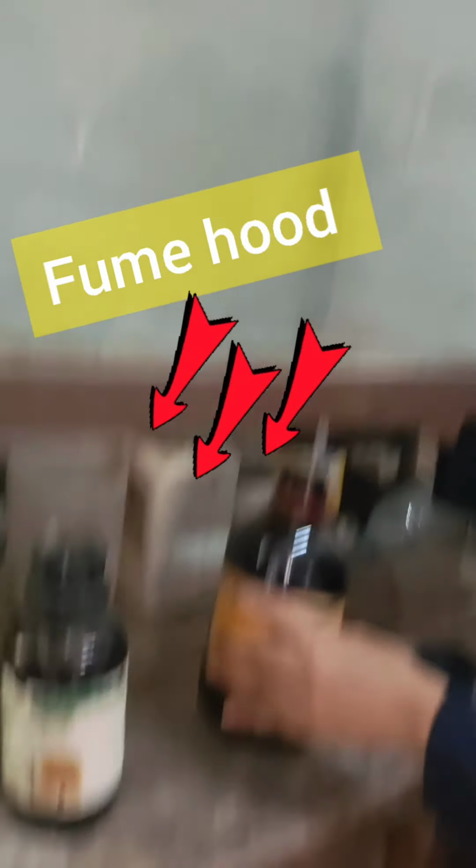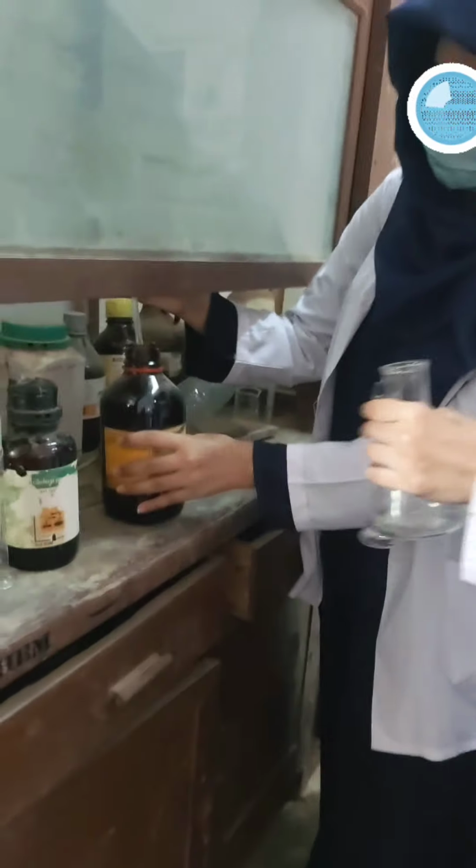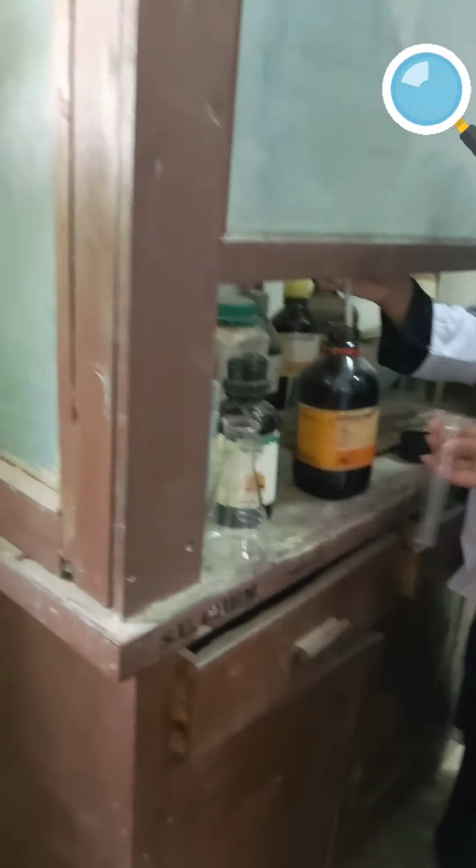I have explained in my different lectures how to use the fume hood. Today they are learning how to use it. So that's great. Do the mixing inside the fume hood. Great. I'm glad that they are doing their work nicely, and they have mixed the benzoyl chloride.